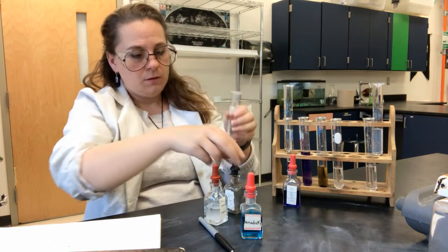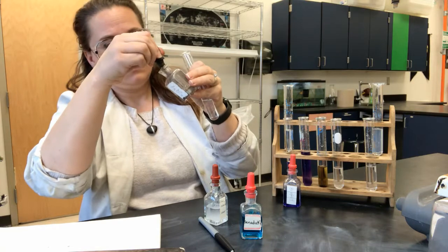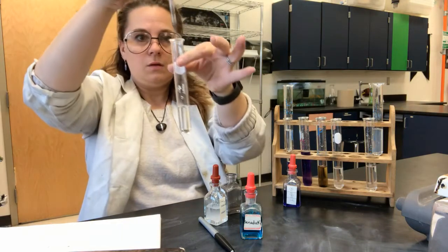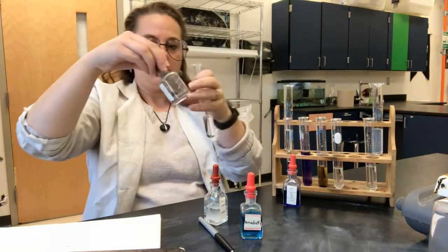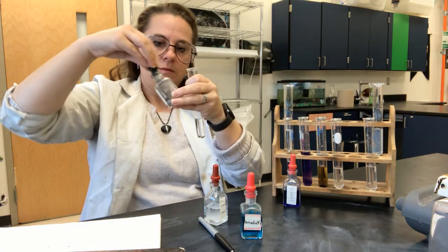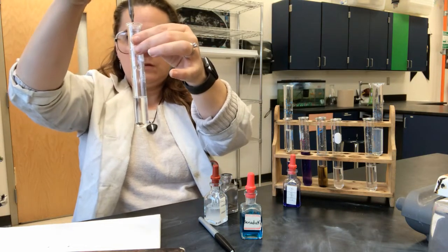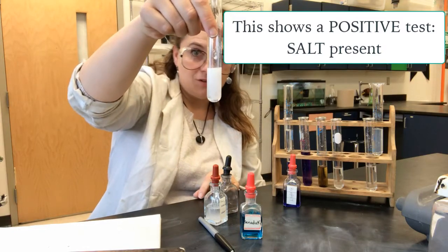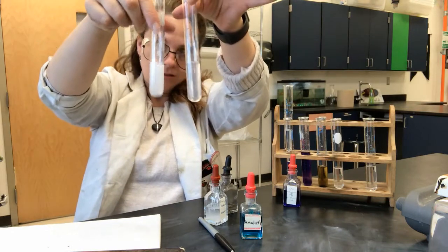Now I'll grab the solution with salt present to show you the positive test. When the silver nitrate goes in, you can see this milky white solid forms as it mixes with the salt in there. So again: no salt present — clear solution; salt present — white milky precipitate. That is how you use silver nitrate when you're looking for the presence of salt in a solution.